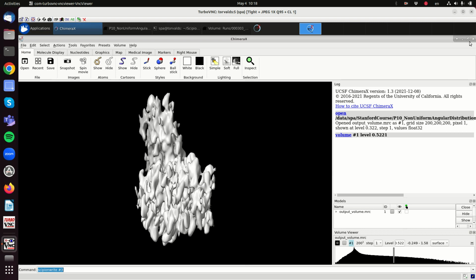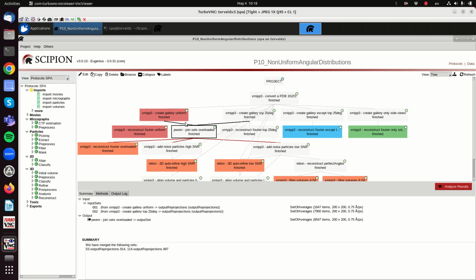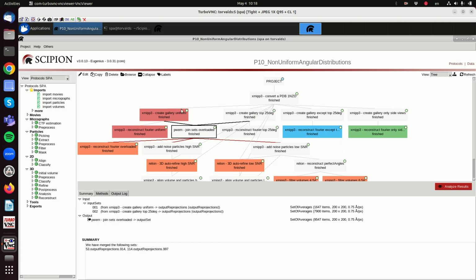And now what happens when we add noise, or when we put both together? Let's say that we put both together. So we have a uniform distribution and more views from the top. This is 1 in 4 if you want. So 20% of the particles have a uniform distribution, the other 80% are coming mostly from the top. Should we expect any deformation, because this one is creating an elongation? In principle we shouldn't, because we are filling the full space. Let's see if that is true.